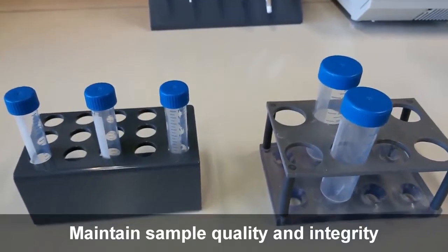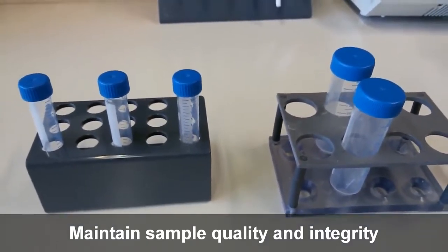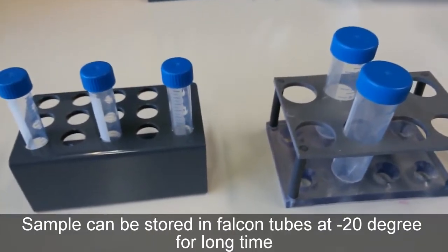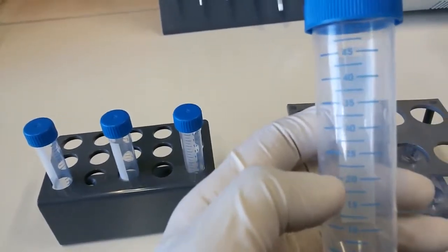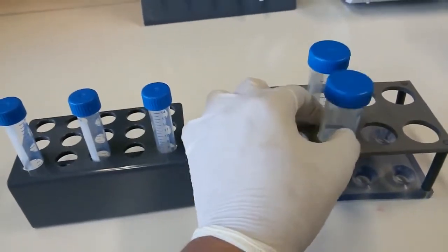We use these tubes for a very important purpose. For example, if you want to prepare 20 ml of magnesium chloride solution, you can use these tubes. The good thing about these tubes is that they are also quite accurate. So if you see 20 ml here, it's actually 20 ml.